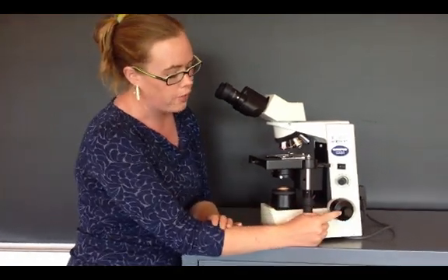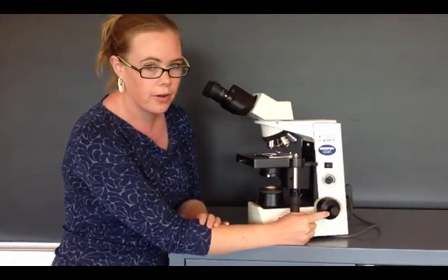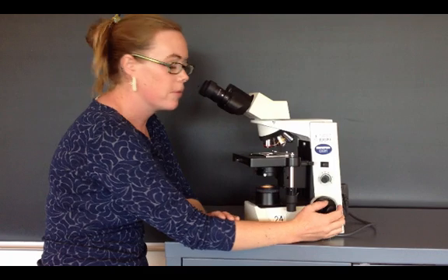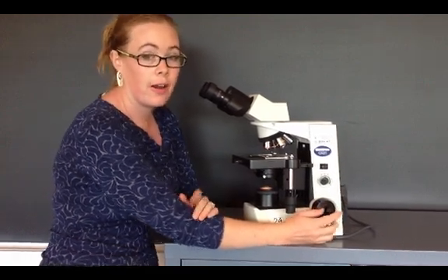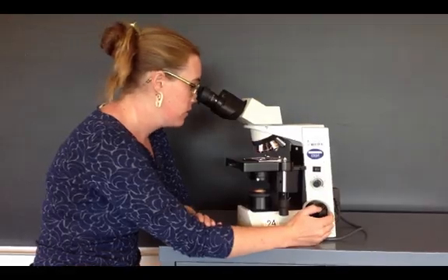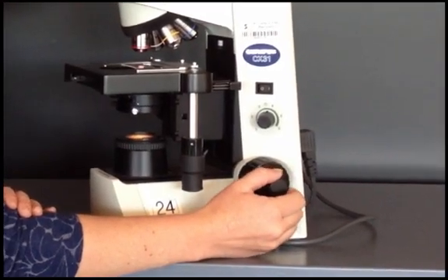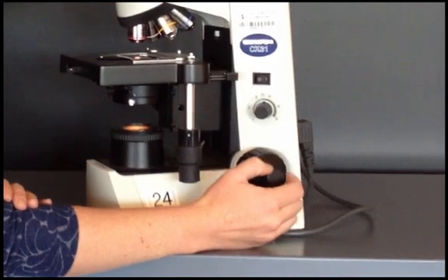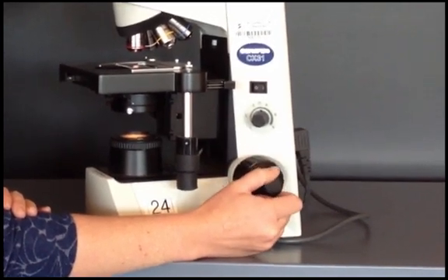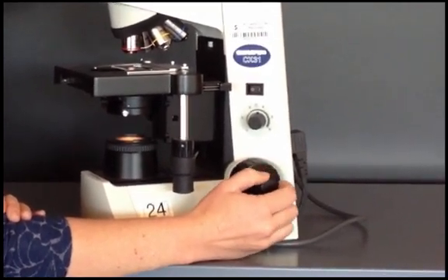Then you're going to use your fine focus, this smaller knob here, to adjust it even further. Again, only looking through with your right eye. Move the fine focus back and forth until you determine the most clear picture.